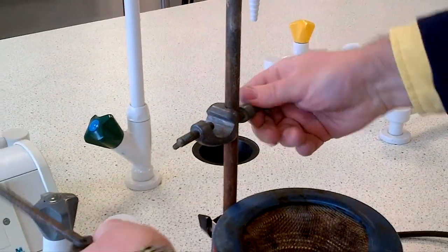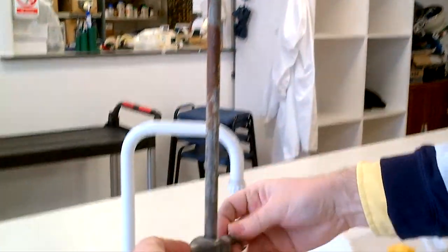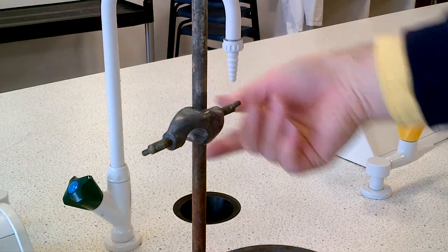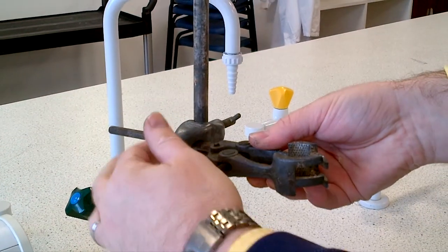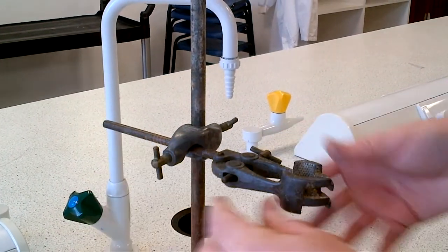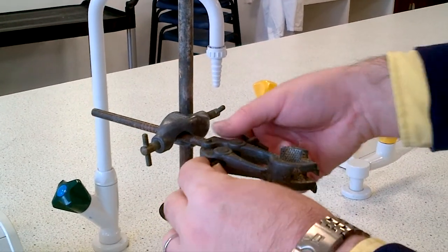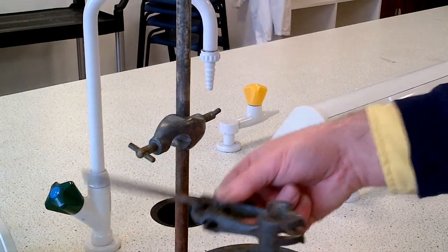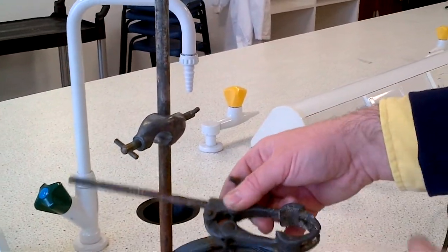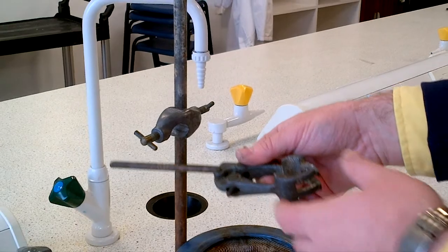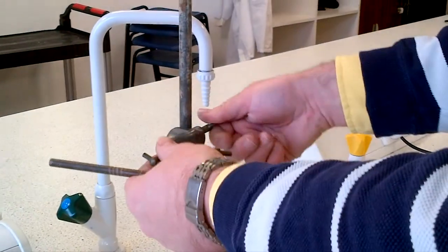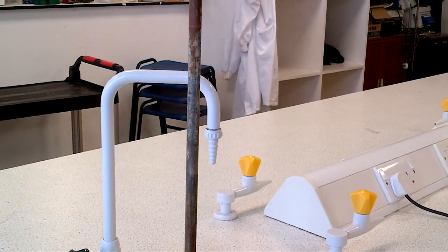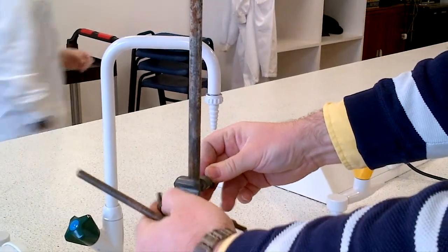If the boss was in a different position with the ridge pointing upwards and clamped, should there be a problem and you need to disassemble and take the clamp out, you would have to push down into the source of heat. This is not good—you can't drag the glassware out or you will burn yourself.